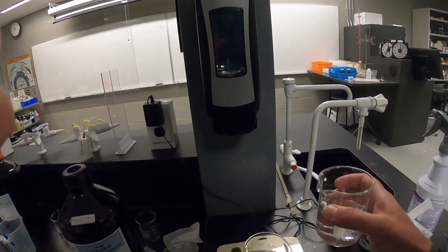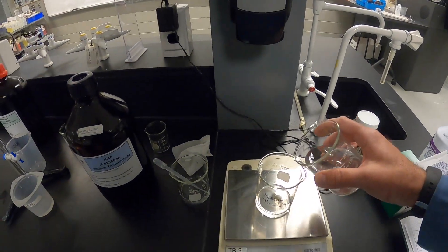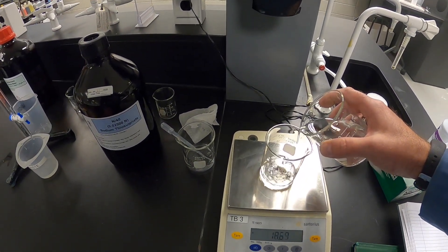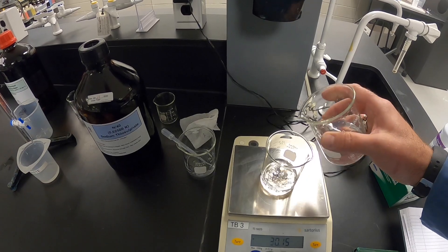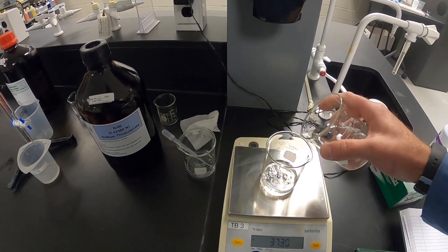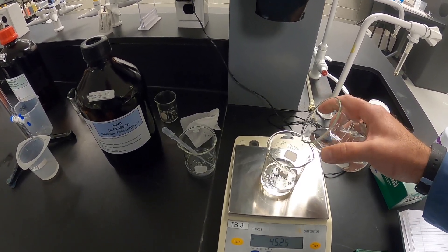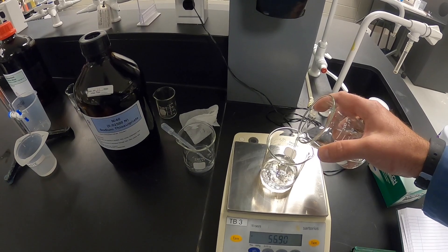Doing this dilution allows us to equate one milliliter of thiosulfate as equal to one milligram per liter of chlorine in our sample. We're diluting this up to 88.6 grams.